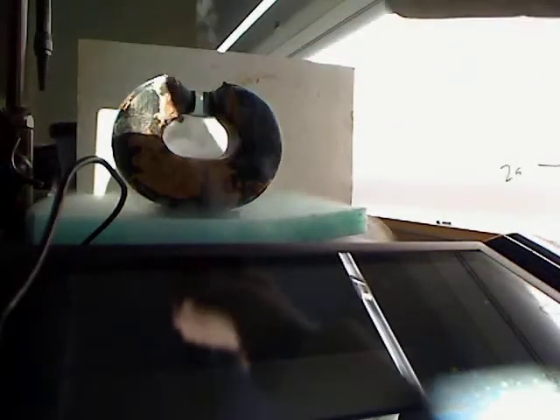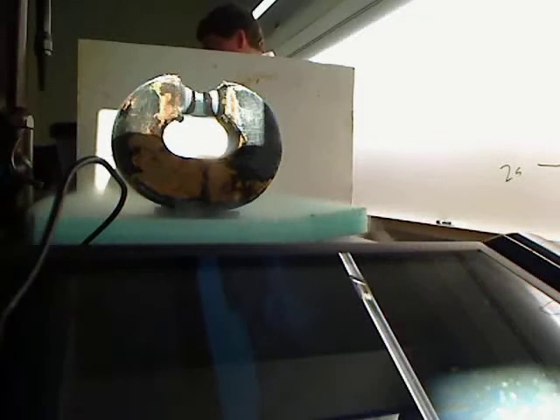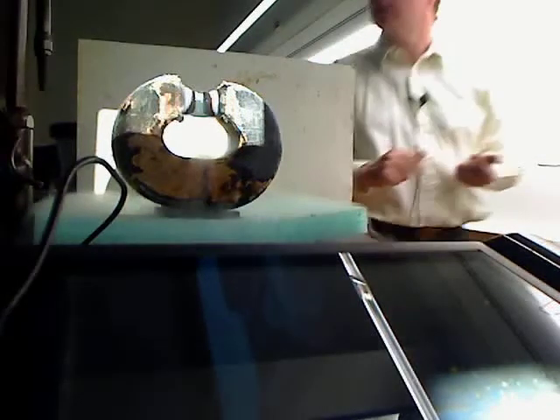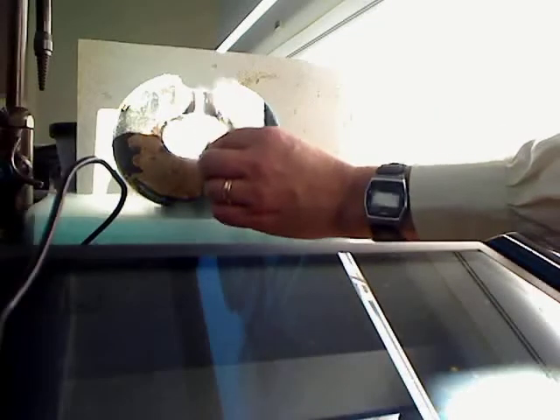Just this blob of liquid in there, it's not frozen in, it's just paramagnetic and it just sits there because the paramagnetic liquid oxygen is held onto the magnet because of the interaction of the unpaired electrons. Cool, huh?